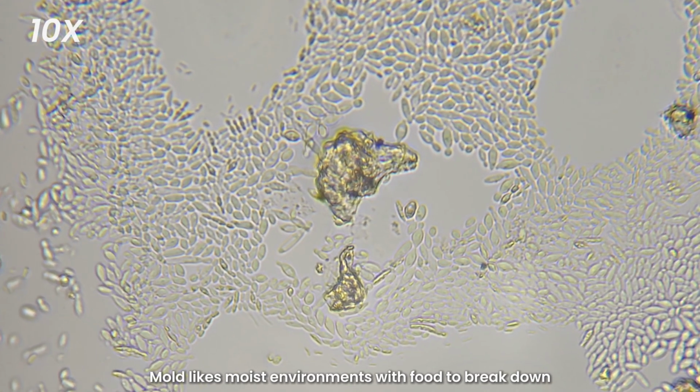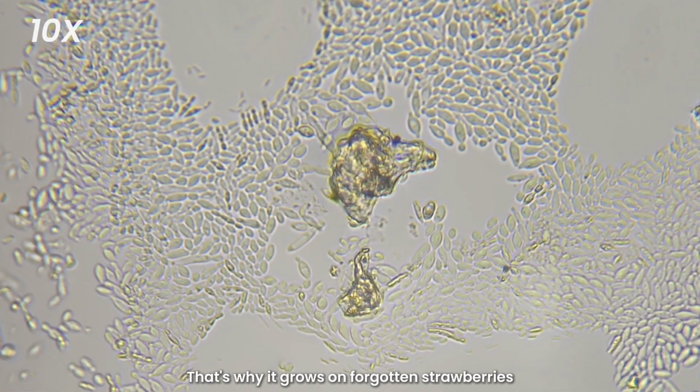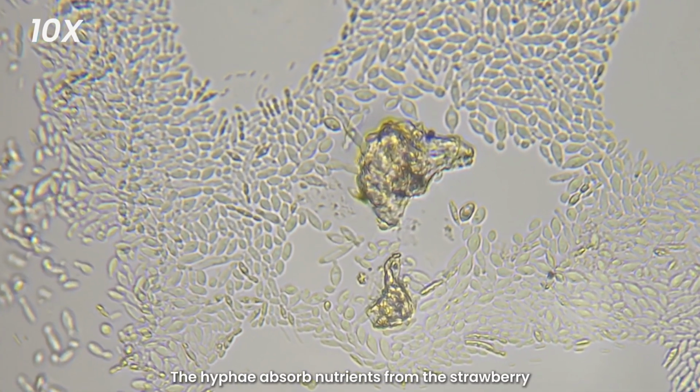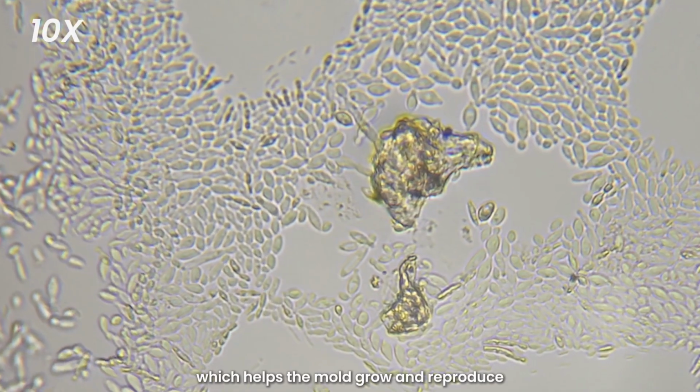Mold likes moist environments with food to break down. That's why it grows on forgotten strawberries. The hyphae absorb nutrients from the strawberry, which helps the mold grow and reproduce.